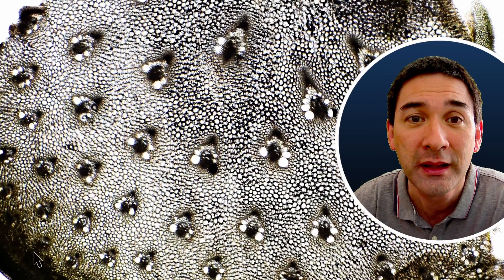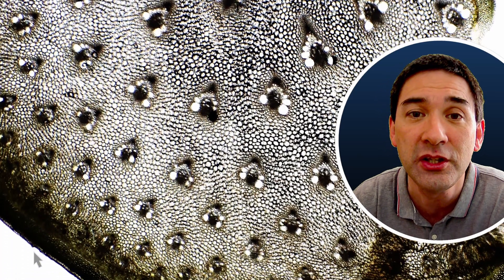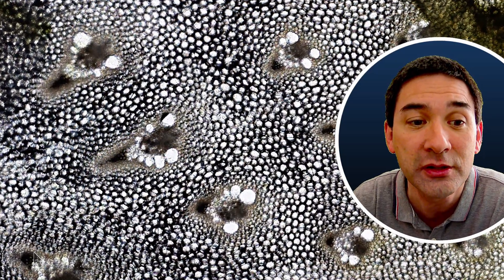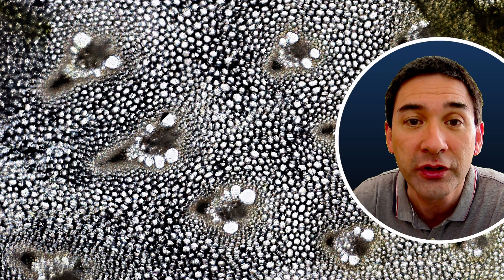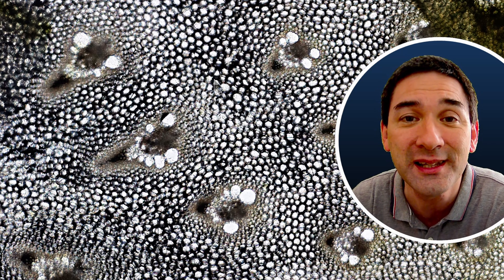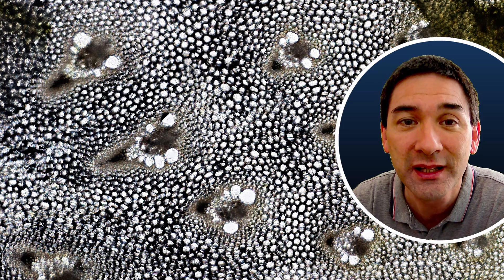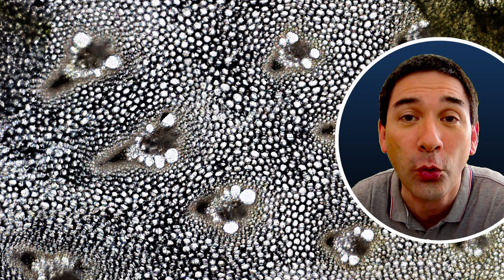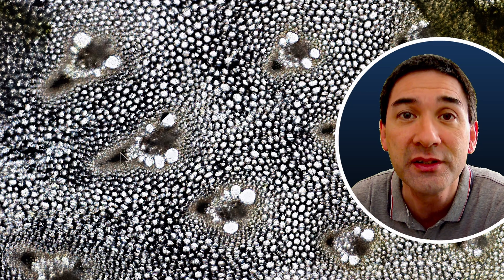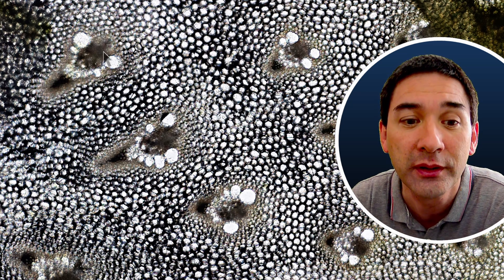At low magnification we can already see the so-called vascular bundles - I've got an arrow pointing to them here. All those little circles you see are the individual cells. You can see that the cut made with the microtome is nice and thin, so the cells are quite well defined with not so many overlapping structures. All of those little structures are the vascular bundles - the cells where substances are transported up and down the plant.